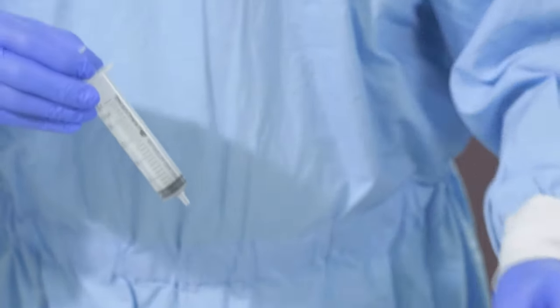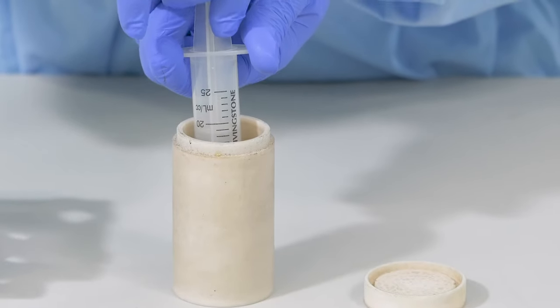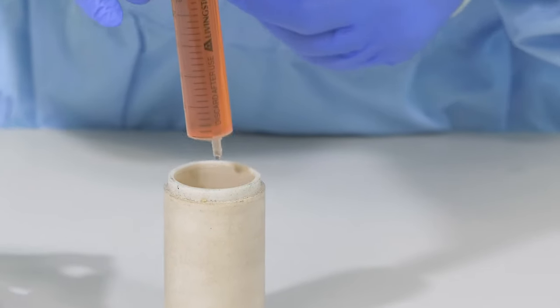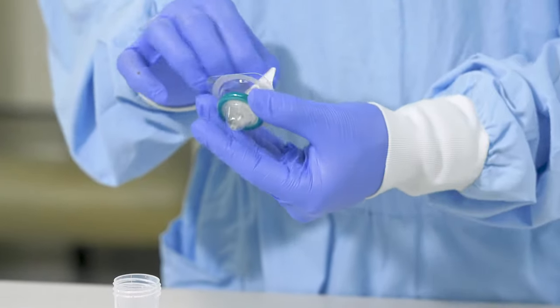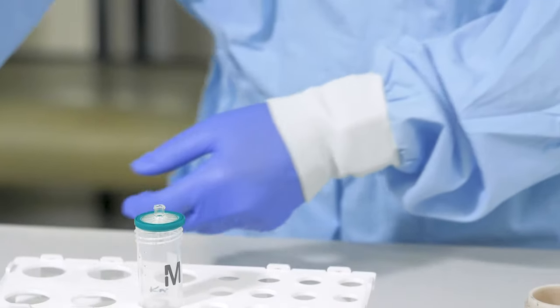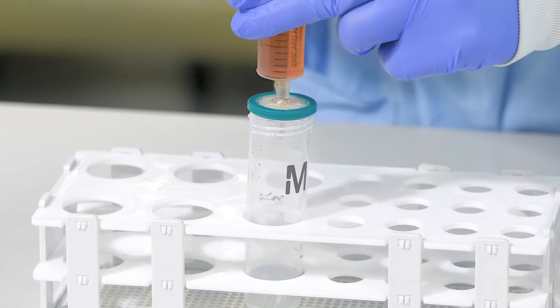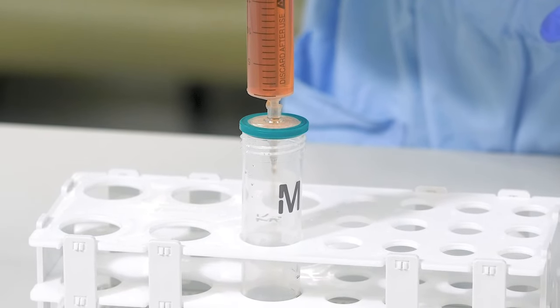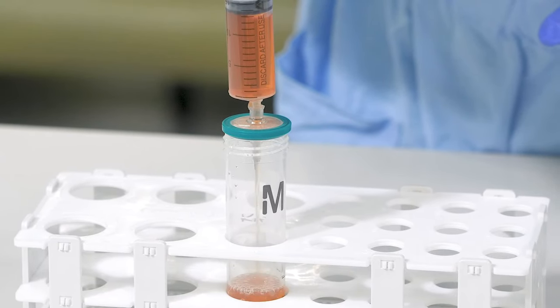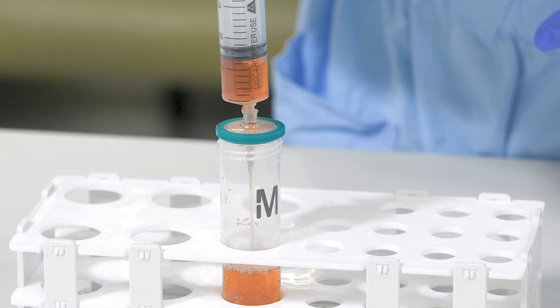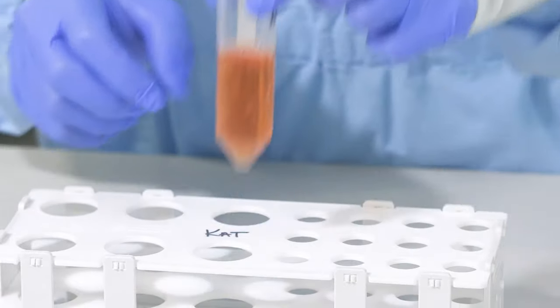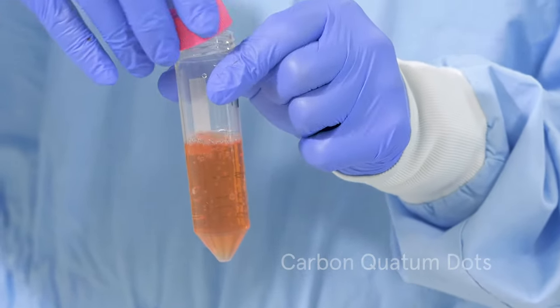I open a syringe and suck up the solution in the teflon. I think you can also notice that the solution color has been changed from yellow color to brownish color. Then I attach a 0.22 micrometer filter and push the sample through it with the plunger into the plastic flask over here. It has a volume of 50 milliliter. That should be enough to hold most of our sample. So as you can see, this filter will help us to remove the contamination and the unwanted particles from our solution containing carbon quantum dots. There we have it. Pure carbon quantum dots.